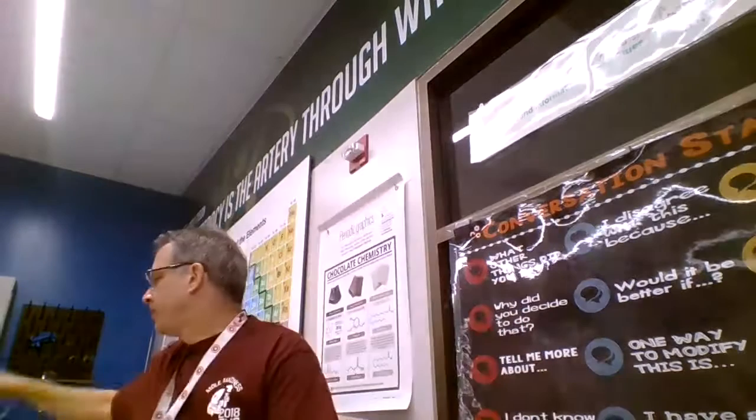Hi, my name is Mr. Houston. Today I'm going to take a couple minutes to explain the next lab that involves moles. This is really in two parts. In the first part, you will be given a container — much like the one I have right here. So as an example, here is container B. You'd write down 'container B,' and you will be given six potential chemicals to choose from to identify what the white powder inside is. Don't open the lid under any circumstances.